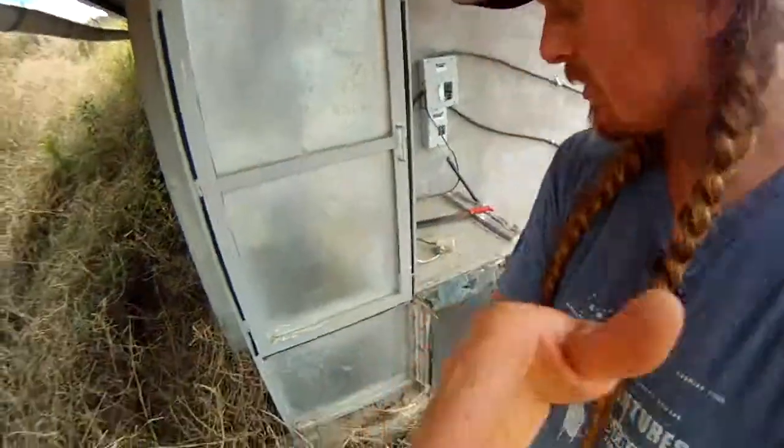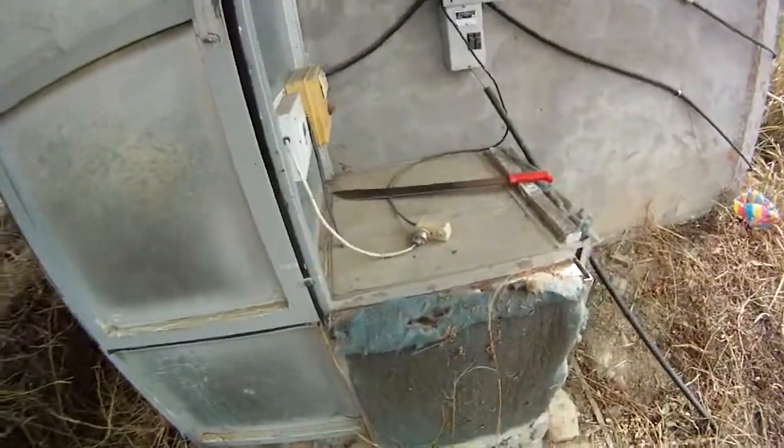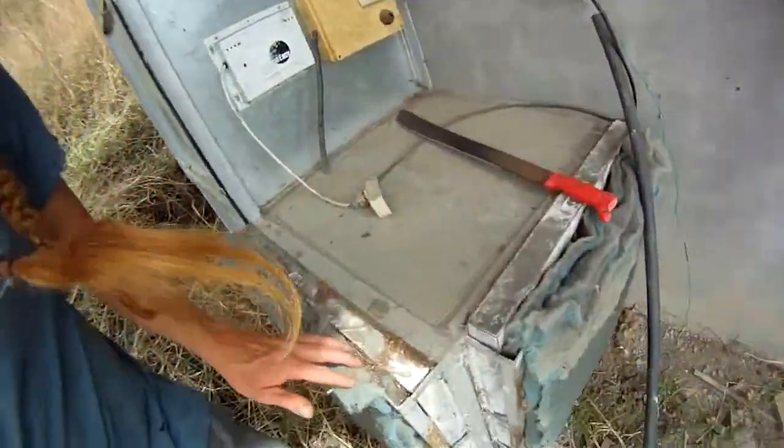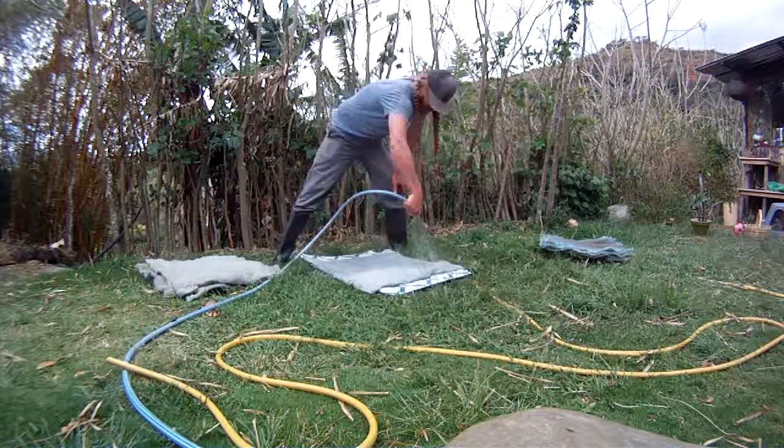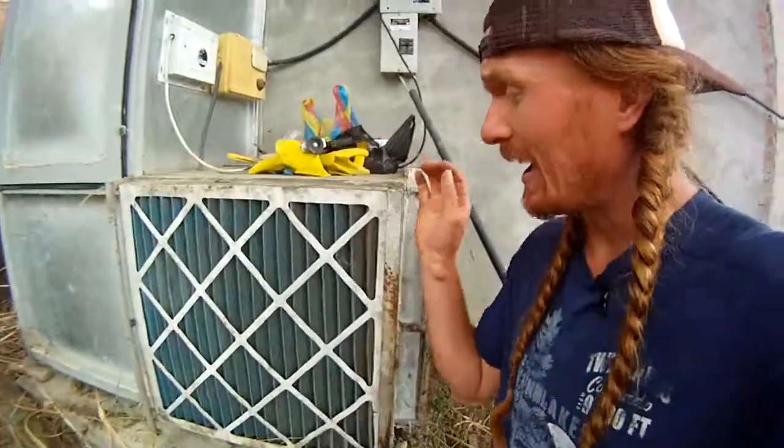So first things first, I've got these dusty pre-filters, and behind them is my second pre-filter. So I'm gonna take those off and clean them. All right, here we are. Pulled those pre-filters off yesterday, cleaned them up real nice. They're over there drying, soaked a lot of dust out of there. Basically, it's four little fuzzy filter pads that pull out a lot of the dust to add a little longevity to this filter. That's kind of the name of the game.